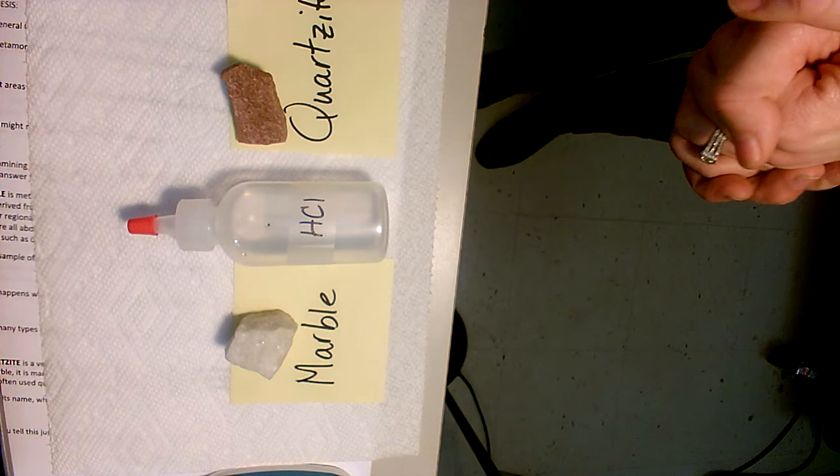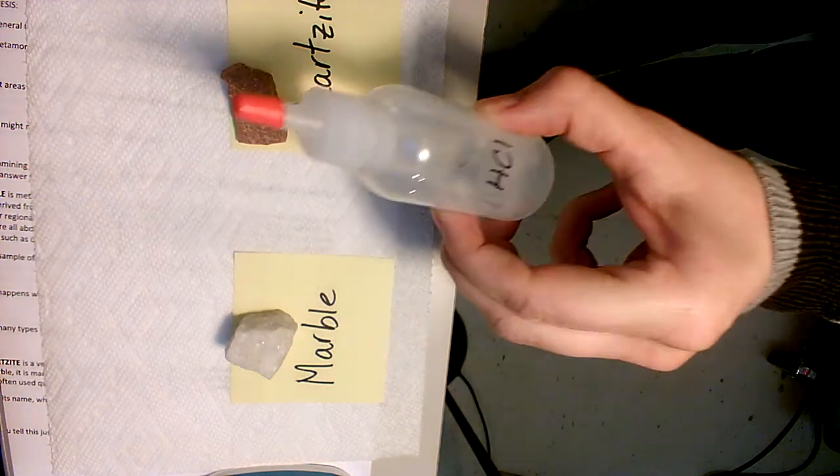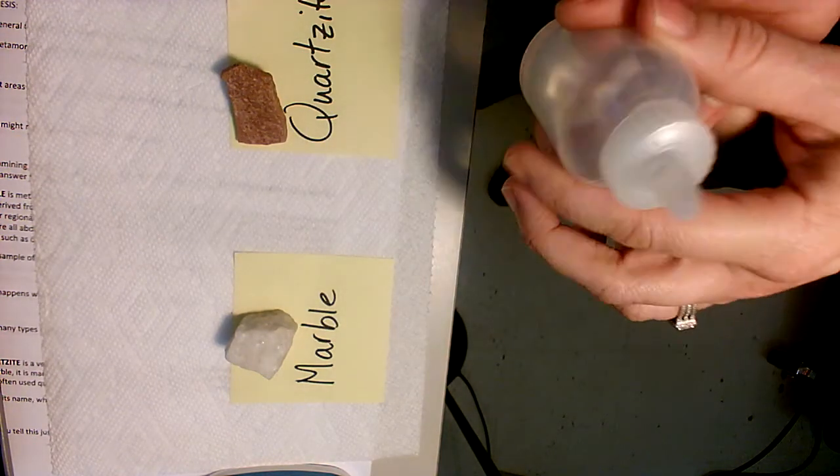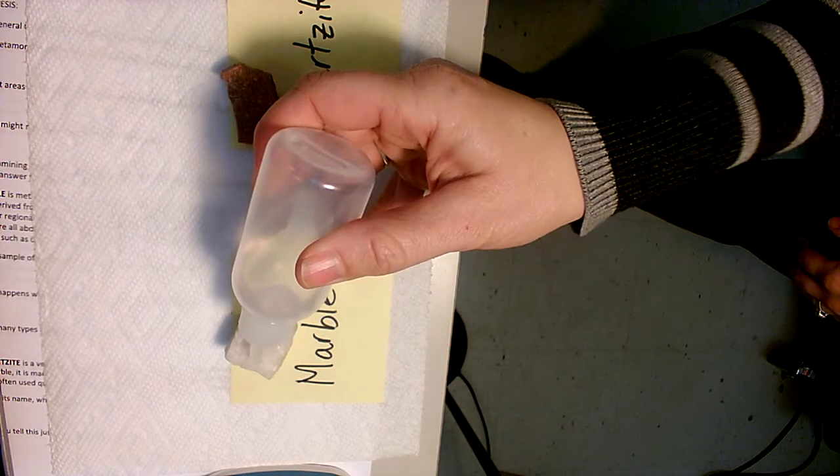One of these is going to react with the hydrochloric acid and one will not. So we're going to drop each sample with a little bit of hydrochloric acid and see if we can see any fizzing.